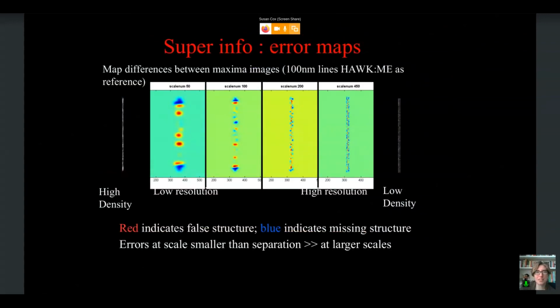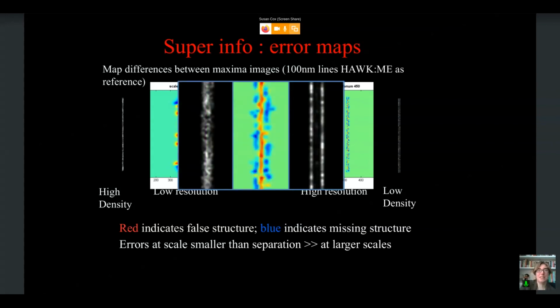So if we have a look at what sort of thing this can do, if we start out looking at different resolutions and what this type of approach can tell us at these different length scales, you can see that if we use a color scheme where red indicates false structure and blue indicates missing structure, as we get to finer and finer scales, we see the structure of the sample emerging. In effect, in the error maps, we can see the missing parts of the sample being highlighted in blue. We can see the false structure in the center of those two lines being highlighted in red. And if we zoom in, you can really see that the high density is localized there in the middle. The incorrect localizations in the center are being identified in red, and the missing structure is being identified in blue.